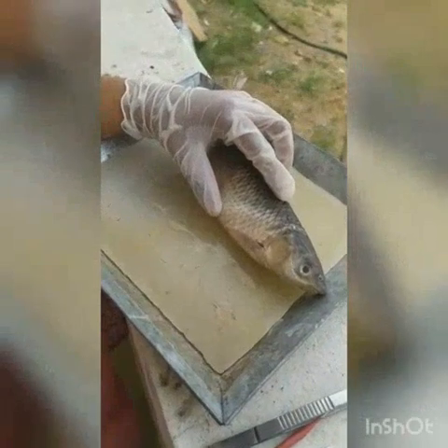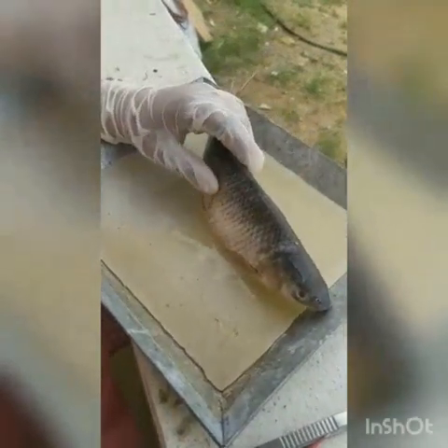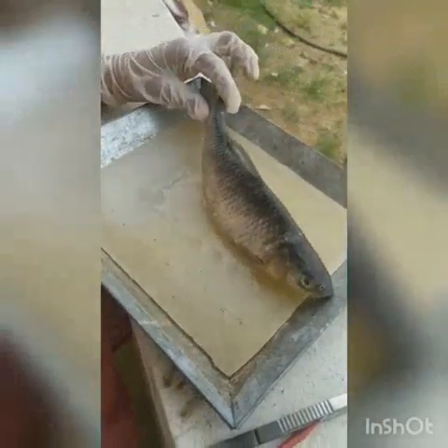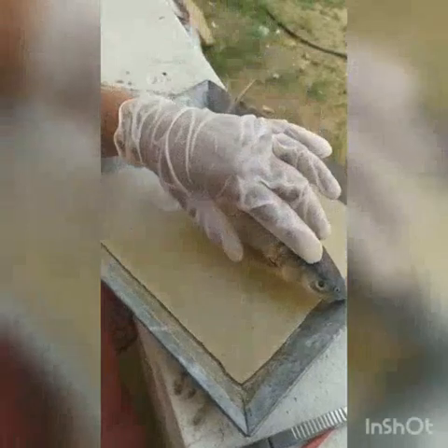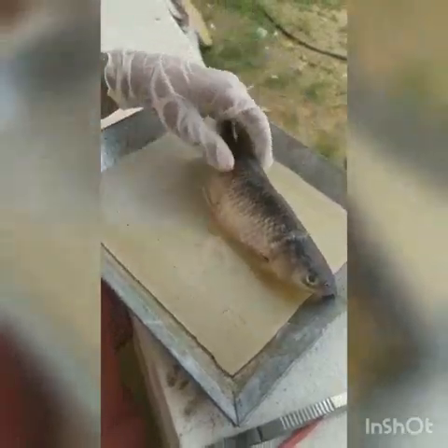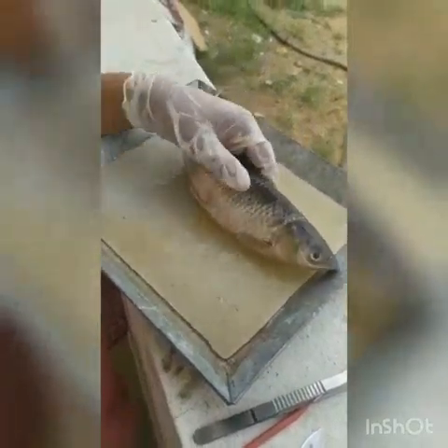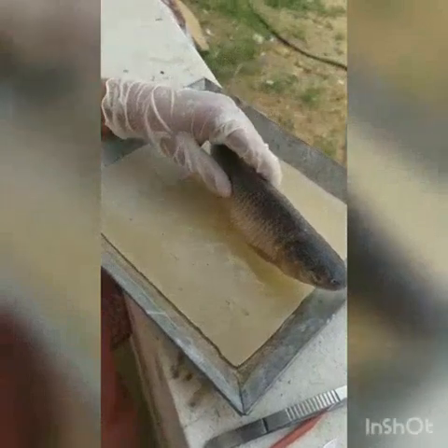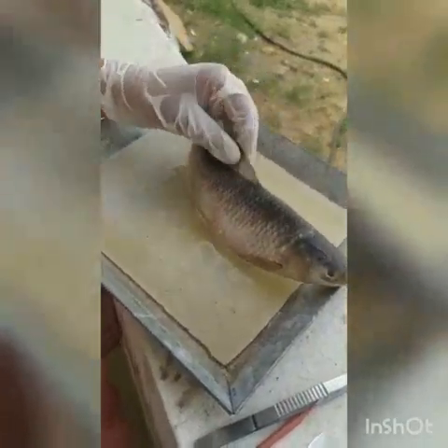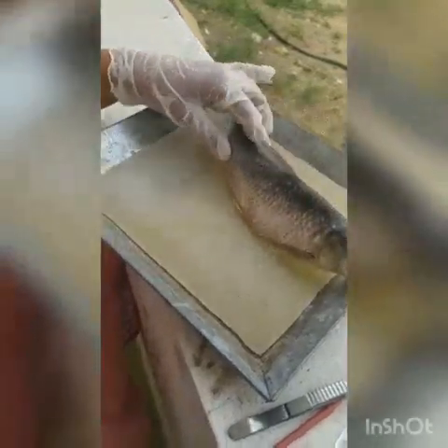The species is rohita. Looking at the external characters of Labeo rohita, it is divisible into three body parts: the head region, trunk region, and tail region. The body is covered with cycloid type of scales all over. This fin here is the dorsal fin, and if you see the shape of the fish, it is a spindle-shaped body.